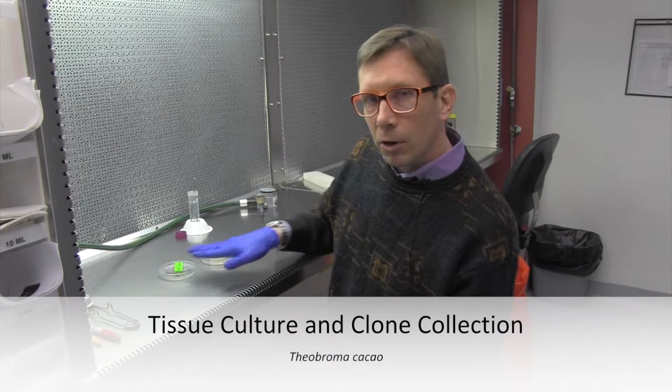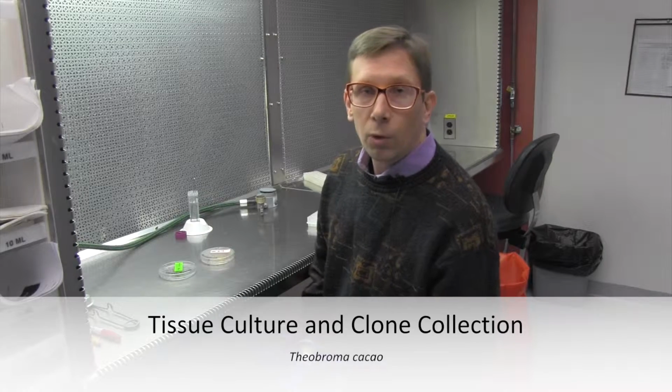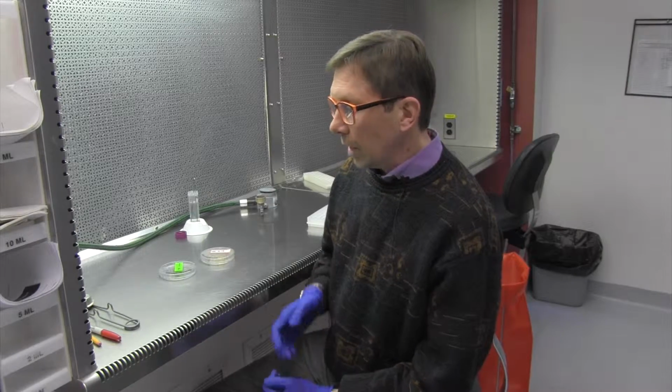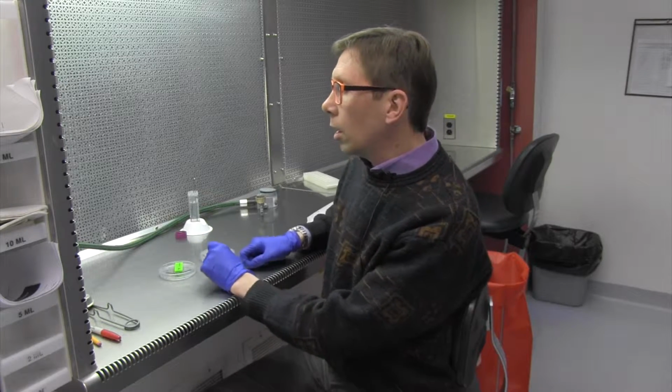We don't have any flowers here at the moment in the lab, but when we start, we always start from a flower. And we cut the flower into pieces, and the petals that are inside, we cut them and then place them onto a specific type of media.